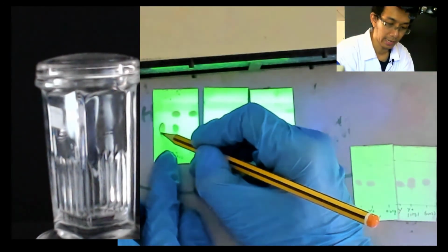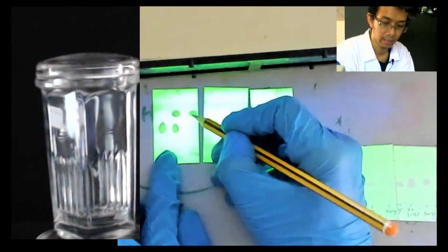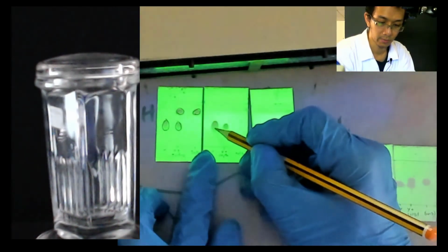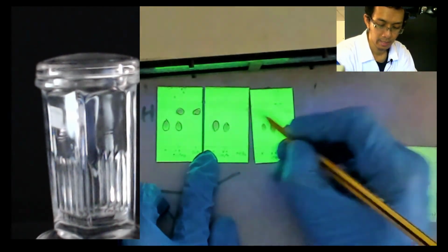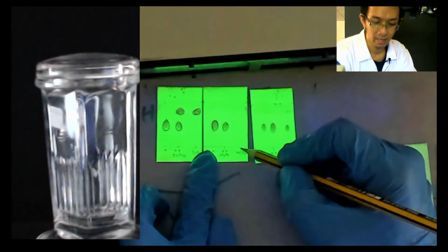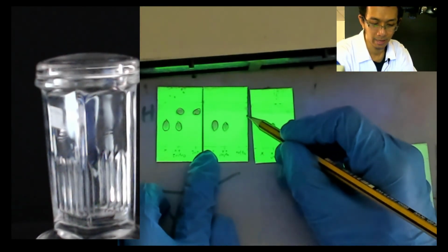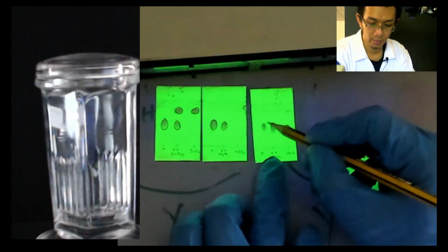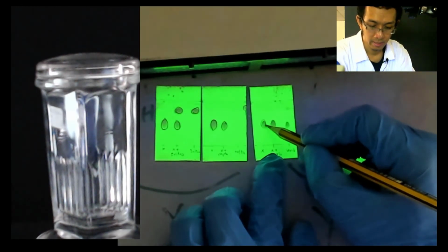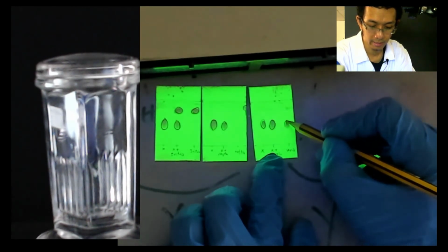I'm using pencil. So I will trace this like that, this like that, and this here, and this here, and this one is here, and then this is here. This is what we call bleeding. It goes a little bit, go away here, it just mind its own business, but it's around here actually. And this one is here, this one is here, and then this one is here.